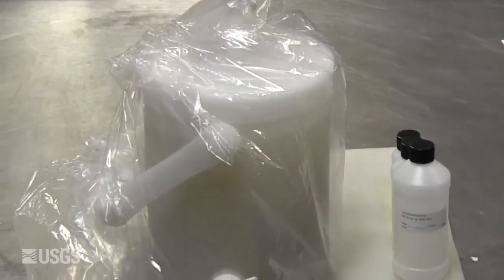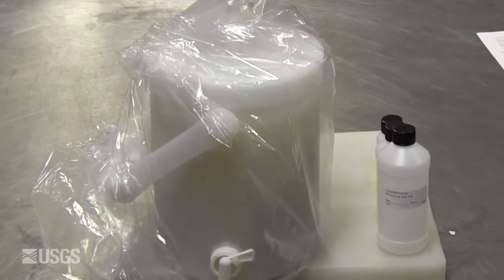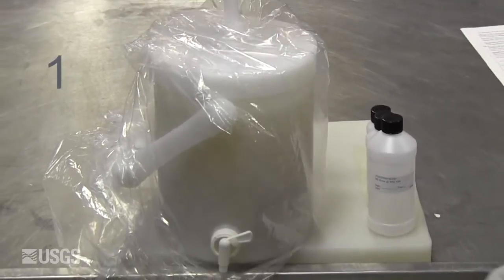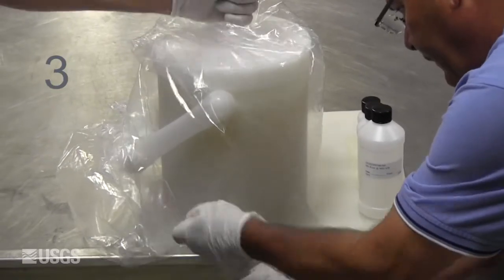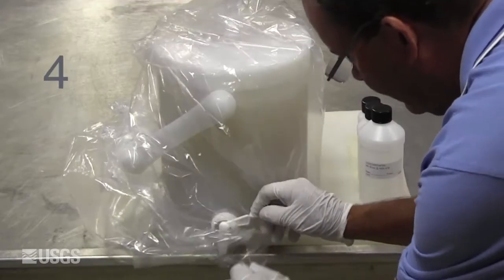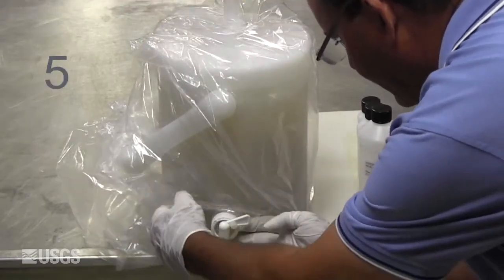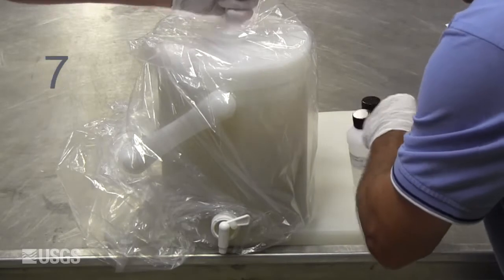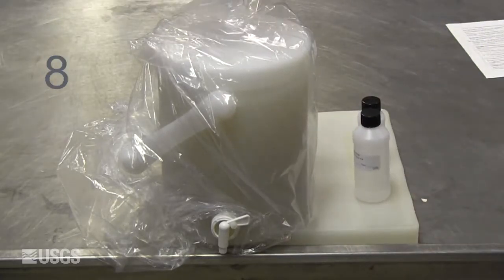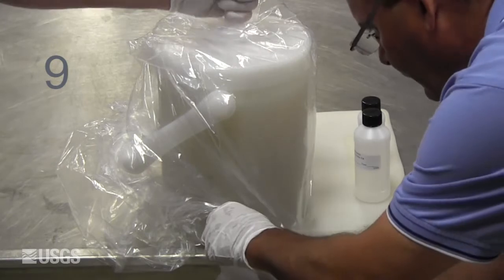Before withdrawing any sample, pre-mix the sample by churning with 10 strokes to uniformly disperse the suspended material. The churning rate should be about 9 inches per second. Inadequate churning can result in non-representative samples.